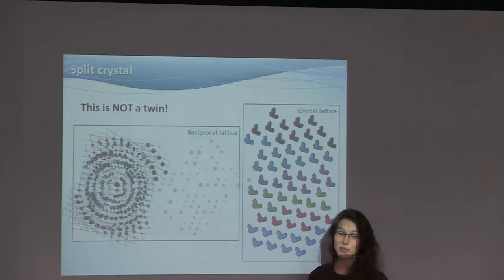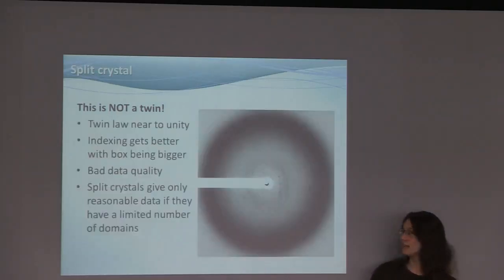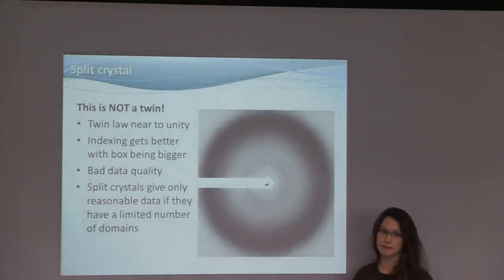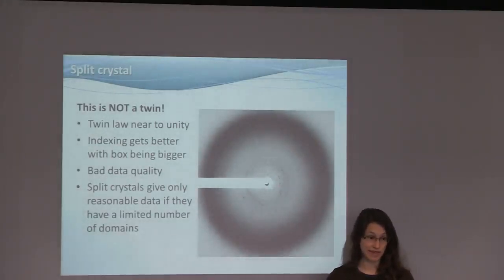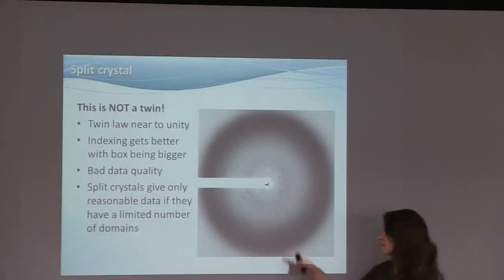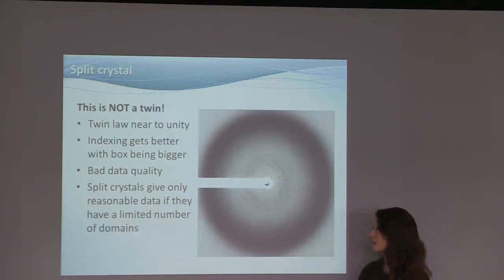We call this then a split crystal. As you can see, the diffraction pattern gets very messy. This is a real example of someone who was very desperate, so they only ever got one crystal, and they got only one data set from it, and that was the data set. And he came into my office and asked whether I could help him because it's a twin.